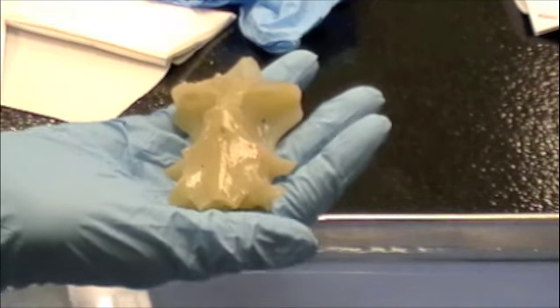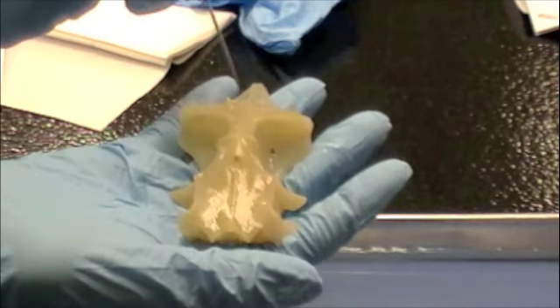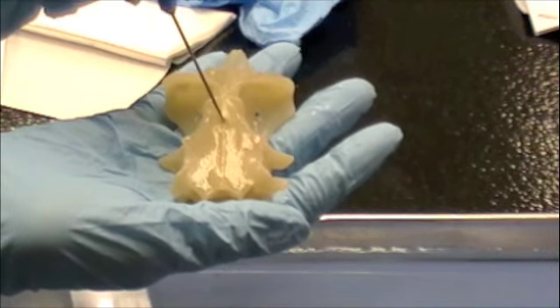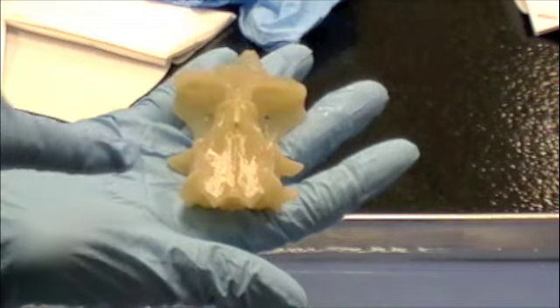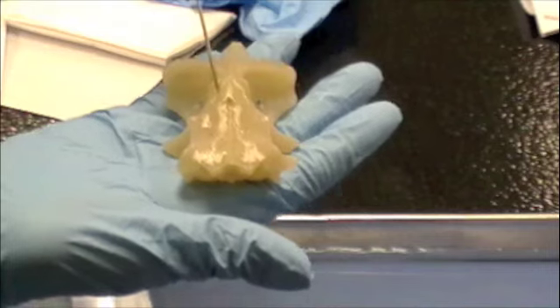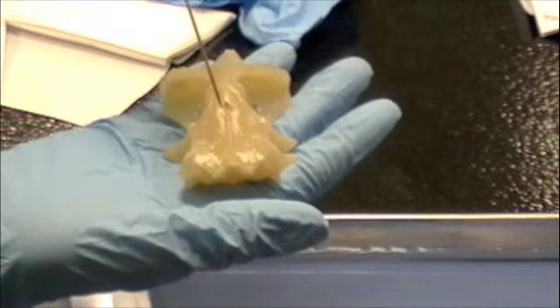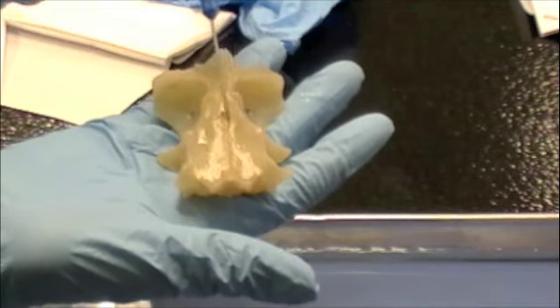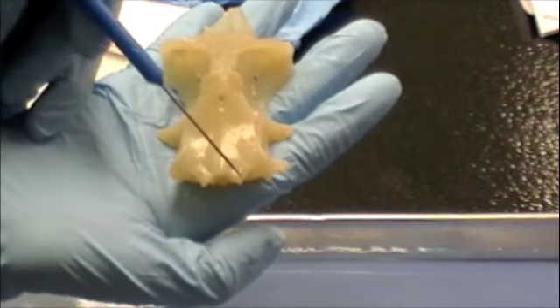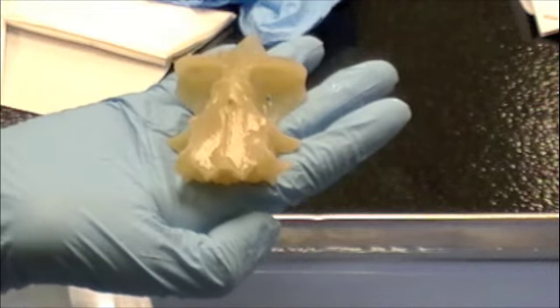It looks like that area — carotid foramen. You can see kind of a midline where the carotid would actually lay against the basal plate, for the carotid artery of the brain. This is the basal plate. And these little things right here are the occipital condyles.